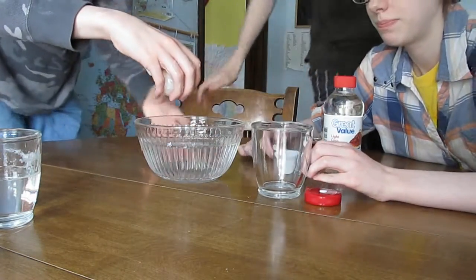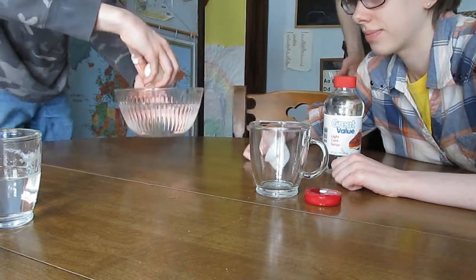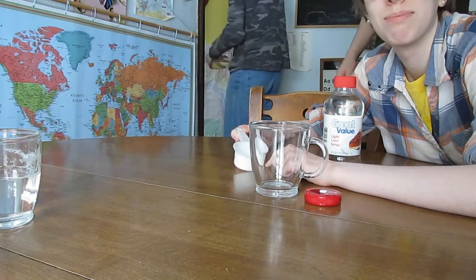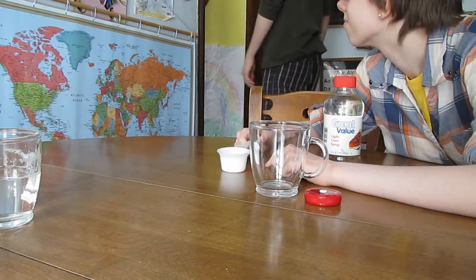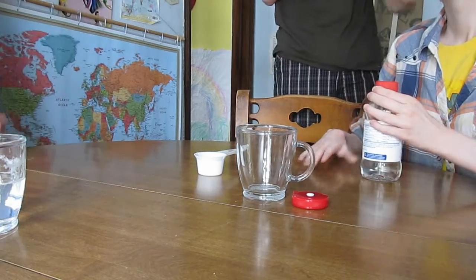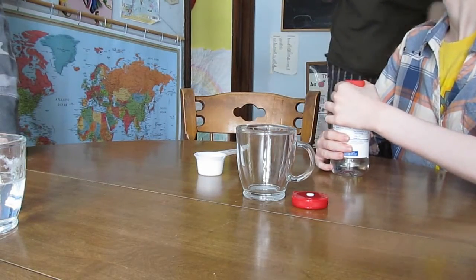Okay, they're going to take it in and rinse it under water. Okay, they're back with the egg. Is it better rinsed now? Yes, yes, it's better.